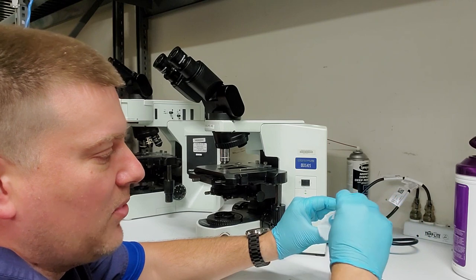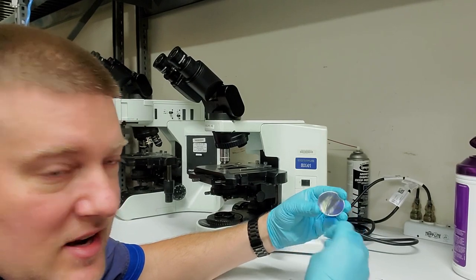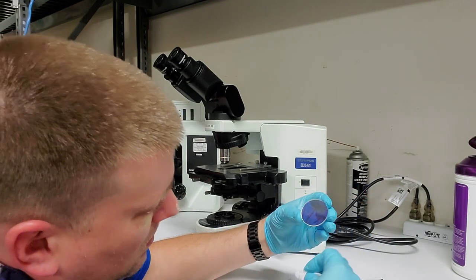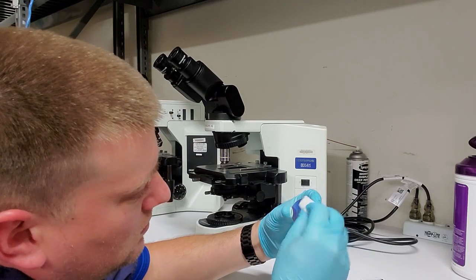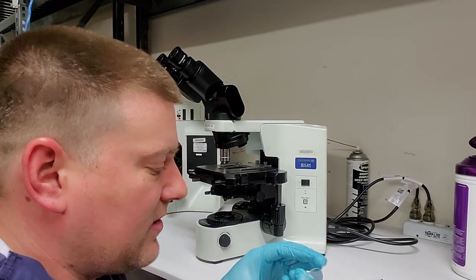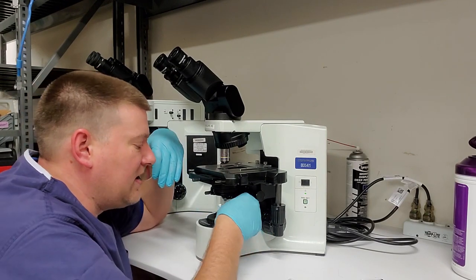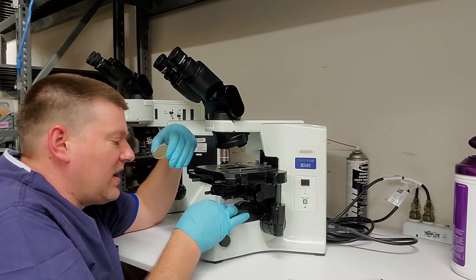So that's why it's very important that you keep everything as clean as possible, because one speck of sand and you could be scratching the heck out of these surfaces. Right. So same thing, hold it at an angle. Make sure that your filter glass doesn't have any debris on it. And now the lens right here, I'm just going to put this guy down in it. Make sure that I get all that debris off it.